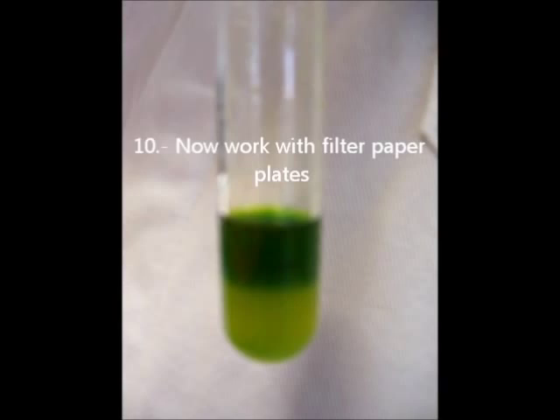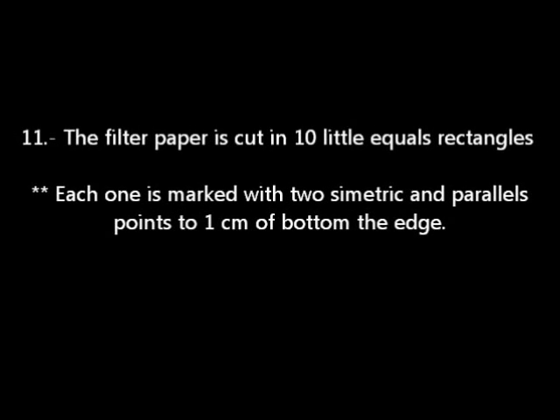Now work with filter paper plates. Filter paper is cut in 10 little equal rectangles. Every one is outlined with two symmetric and parallel points at one cm of bottom edge.